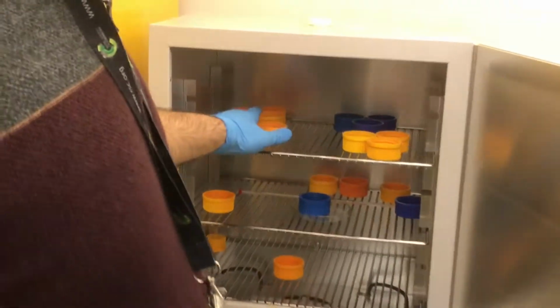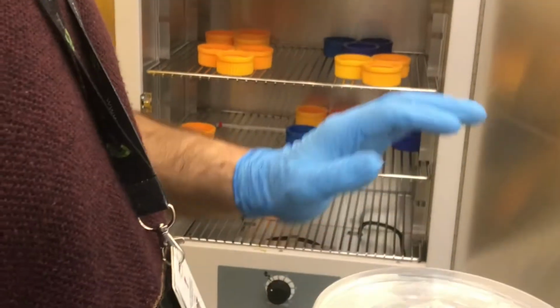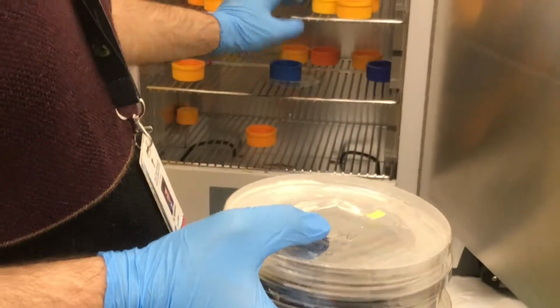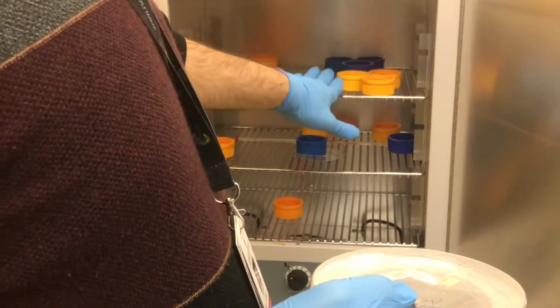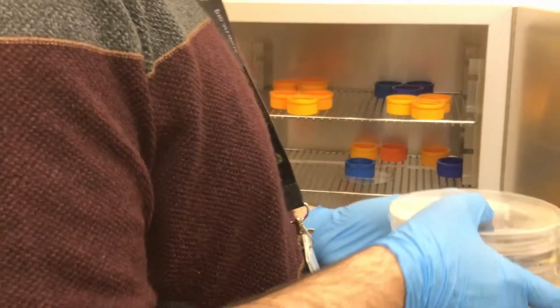Okay. So you put those caps on here. Why? Because when we put the master mold containing PDMS in this, if you put it on the shelf only, it's not completely balanced, and since it's not completely balanced, it's not completely straight. So it has a little tilt, and this tilt affects the thickness of your chip. So you remove the cap. You remove the cover.